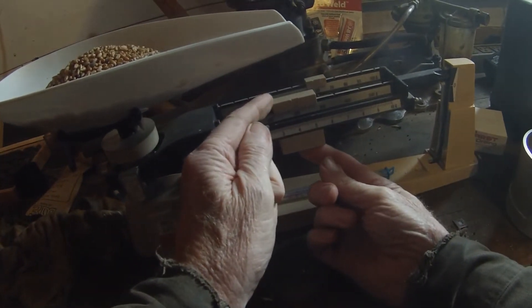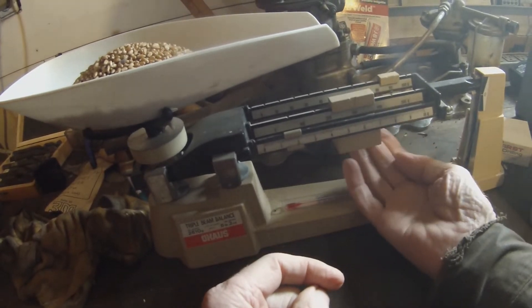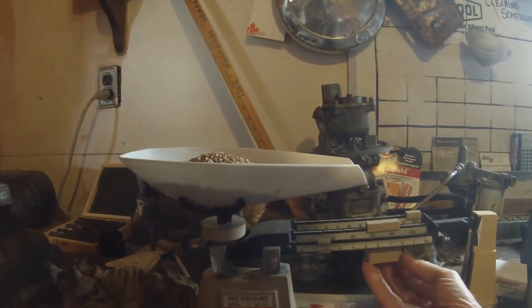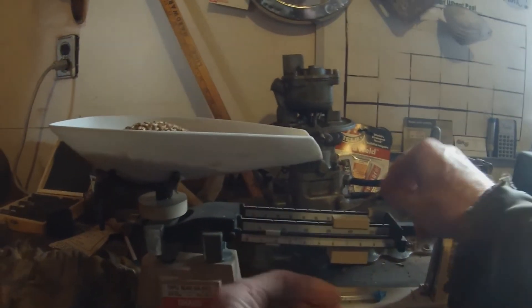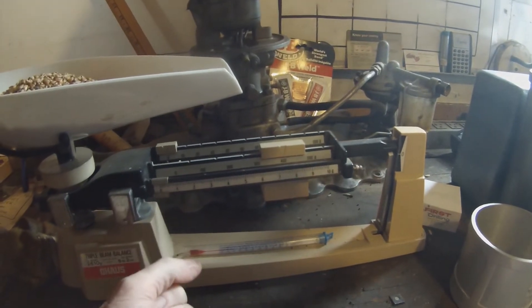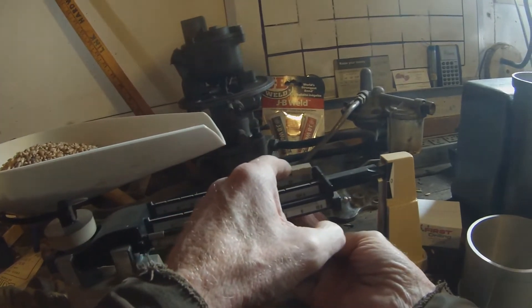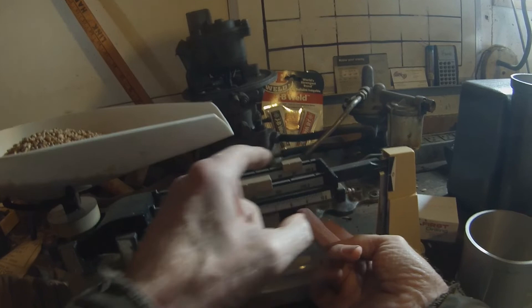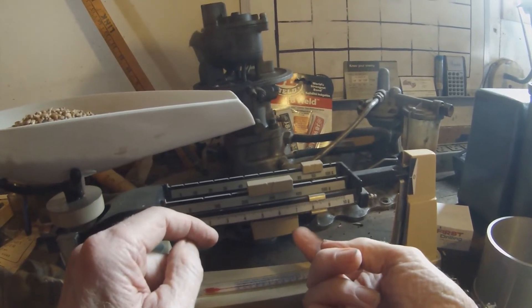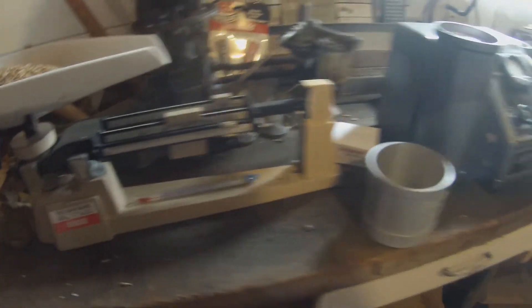Based on past experience I'm going to say this is going to be over 300 grams. Yeah, well over — there's 360, 390, near 400. The lighting is not great in here. We're just under the 400 gram mark — 398 and a half. We'll round that down to 398.